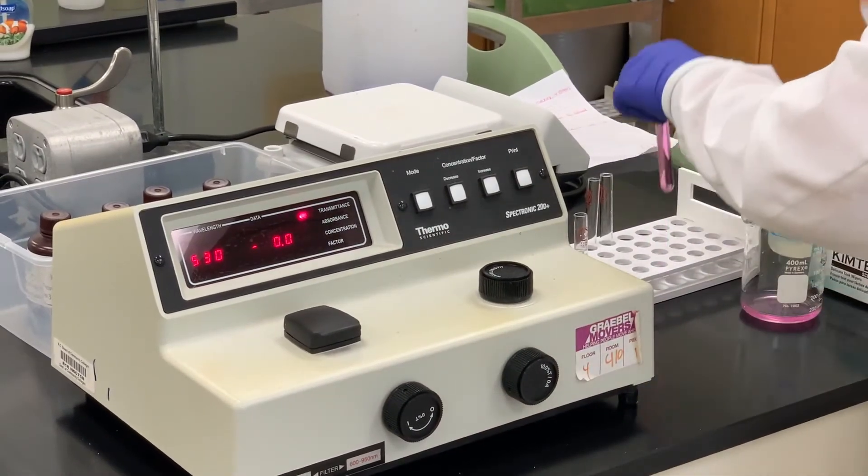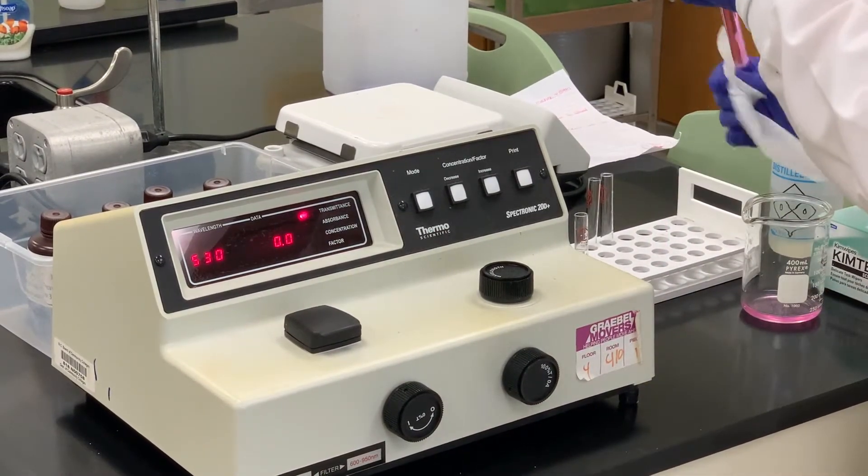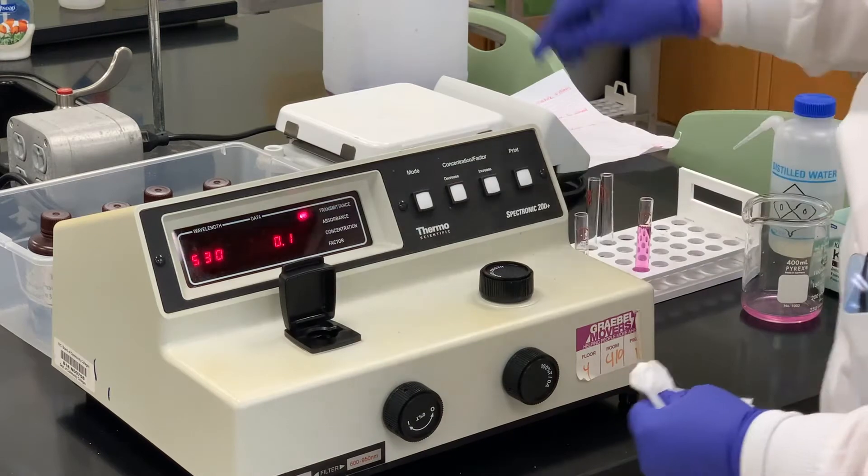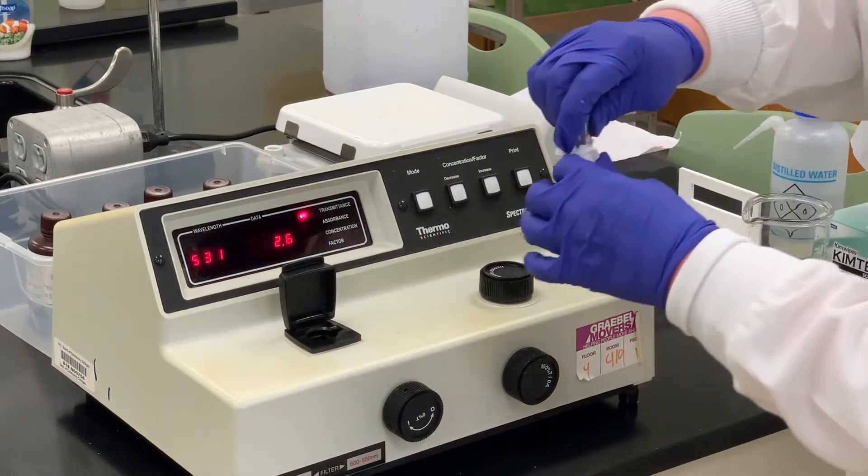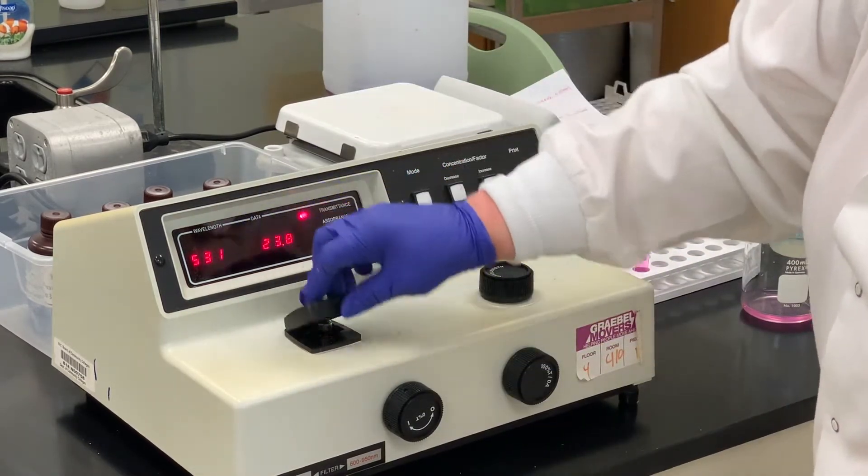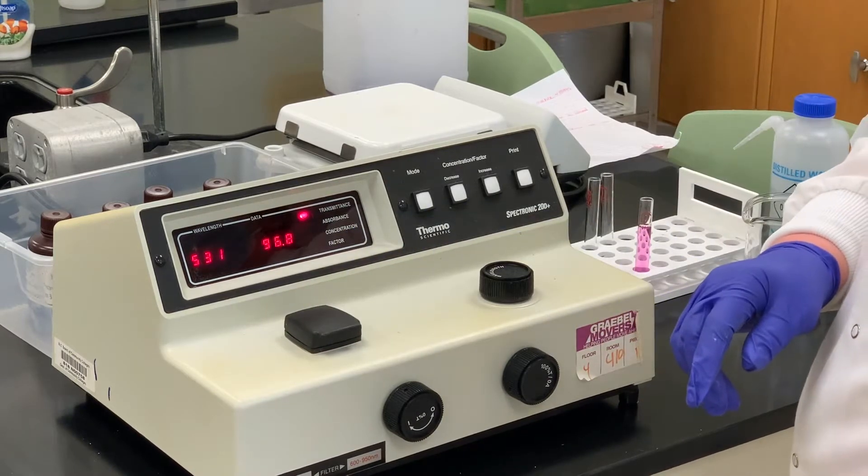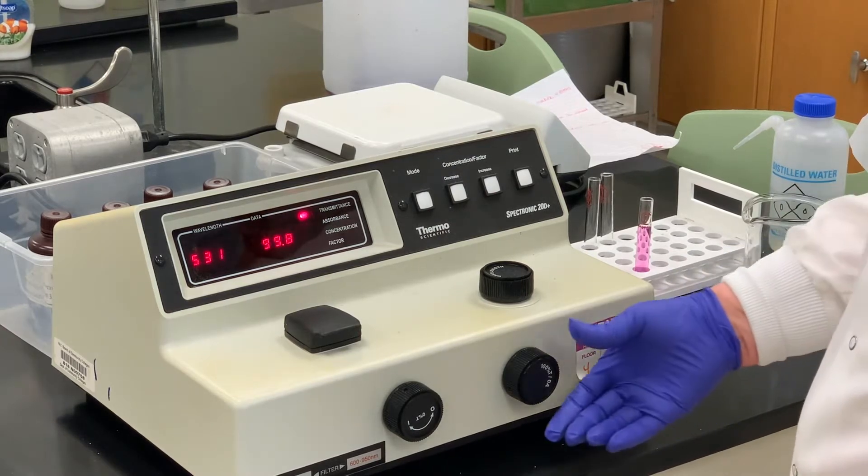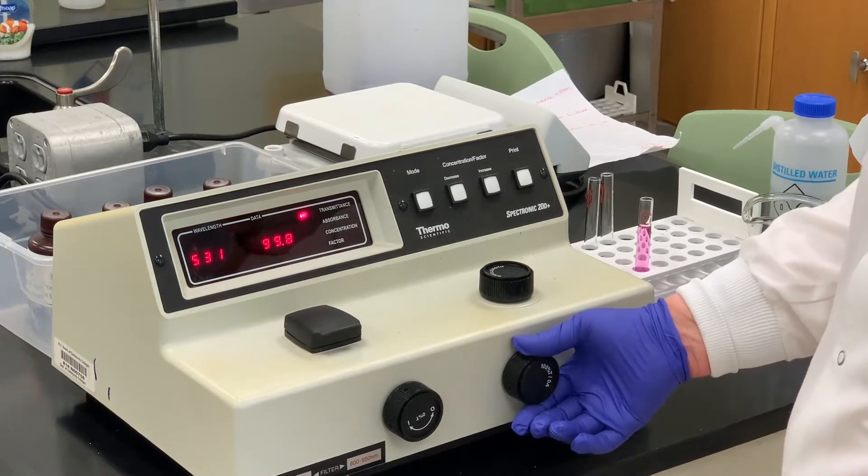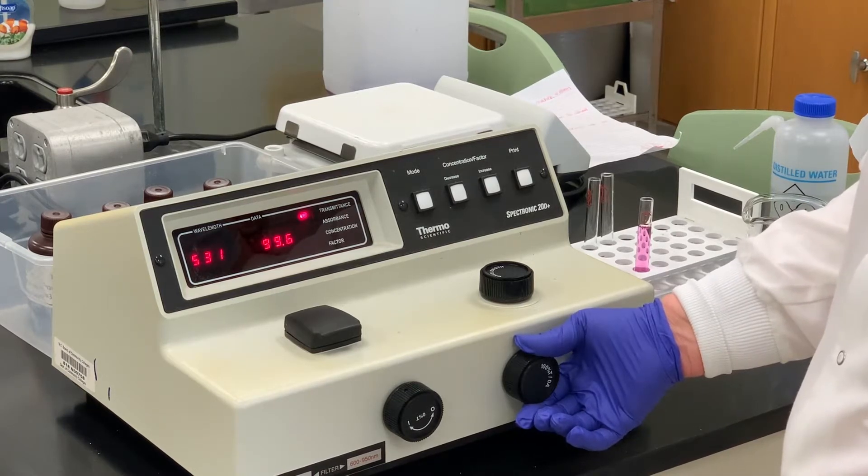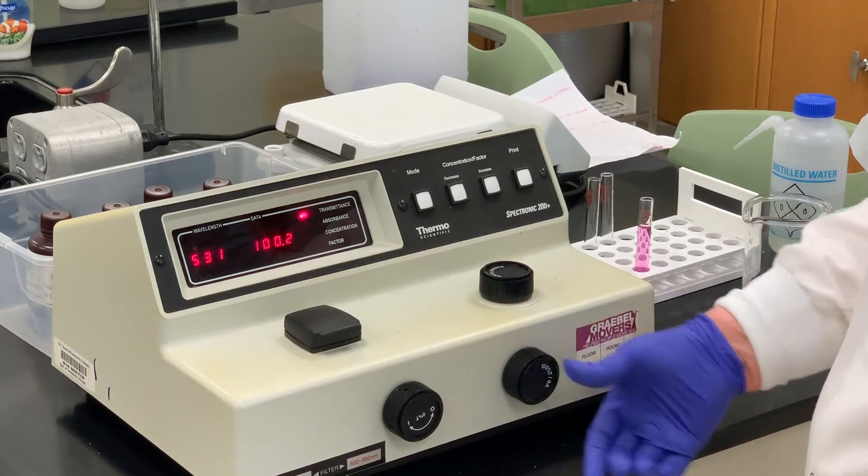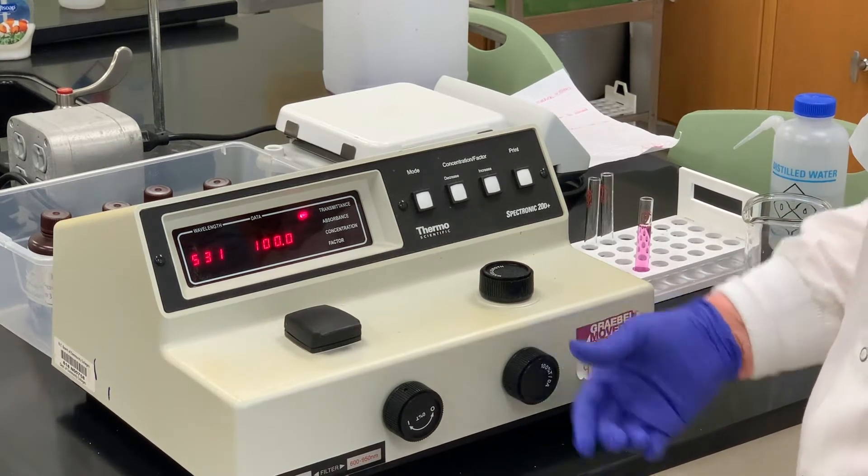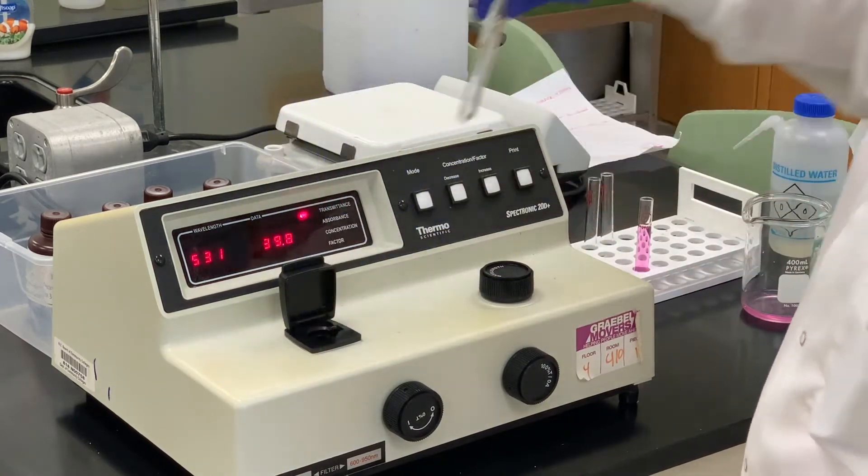So since I've started with solution one, I'm just going to do this as a double check. There should not be any reason to change anything but that should be close to 100 percent. 99.8 and these are so touchy. This is the only really calibration I would do. I don't have to go to the extent that we did before.